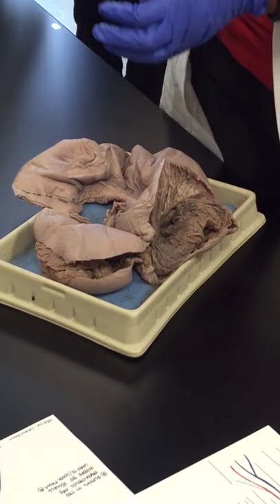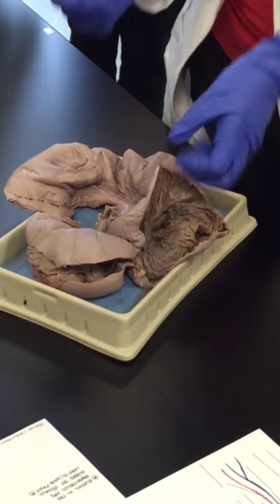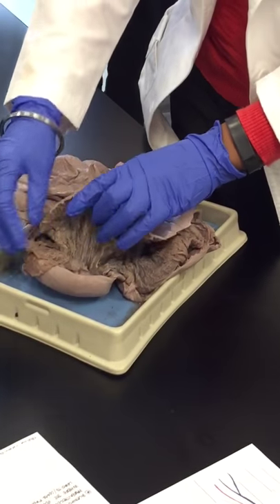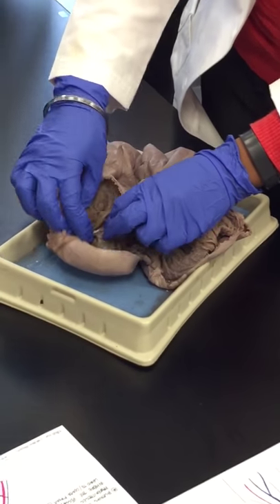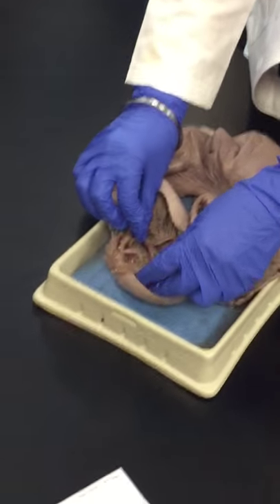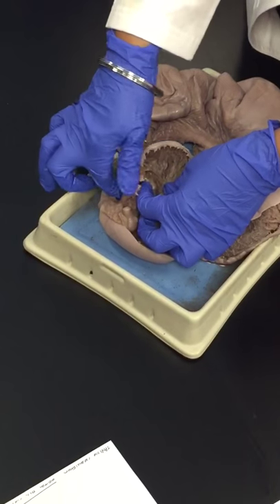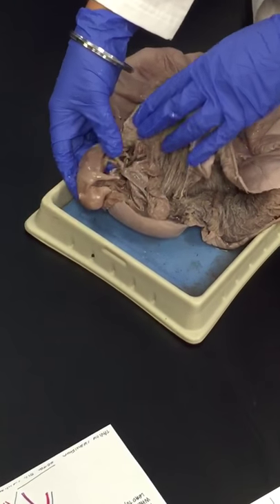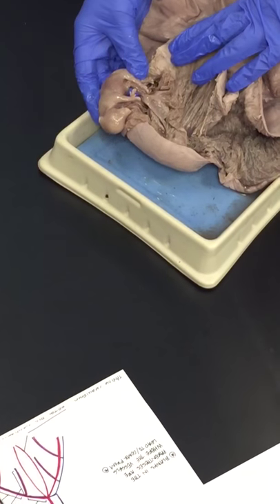If I open this covering, it has some fluid called the amniotic fluid. This is a fetus inside the chorionic vesicle. If you look carefully, this is the umbilical cord attached.